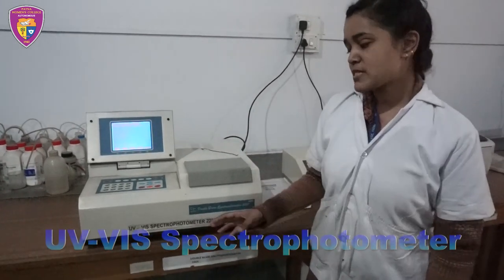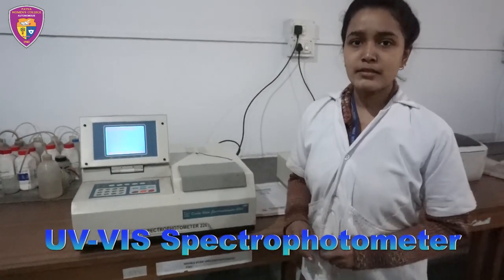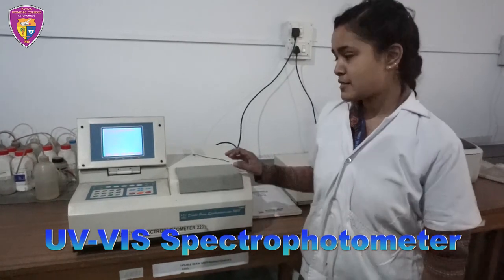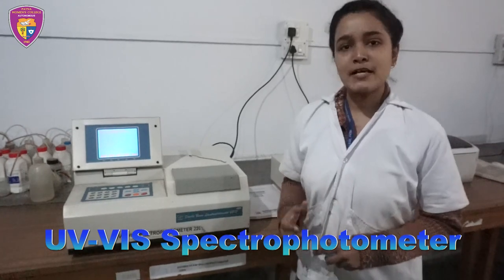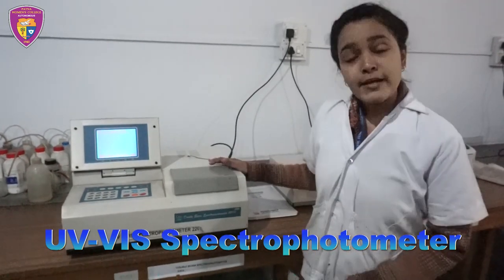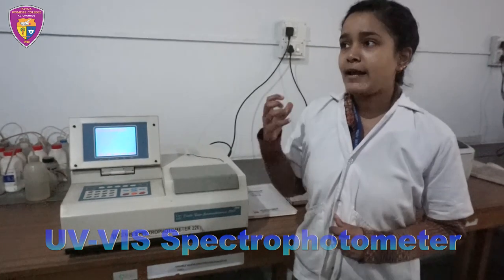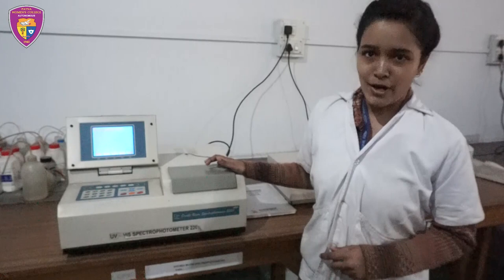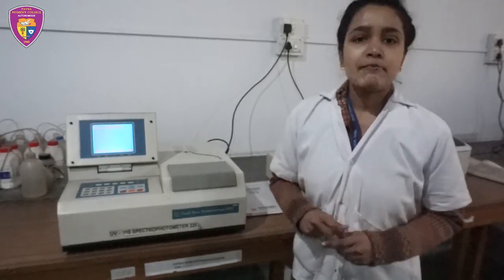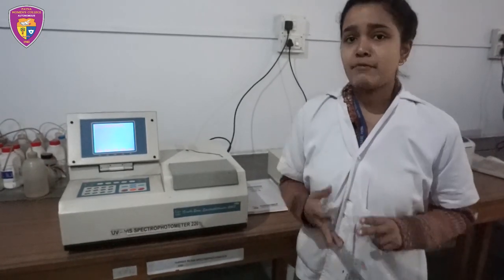This device is called a UV-visible spectrophotometer. It measures the intensity of light when it passes through a sample and compares it to the intensity of light when it passes through a reference sample. It detects transition metal ions and conjugated organic molecules. The samples are loaded in a cuvette which can be made up of quartz or glass.